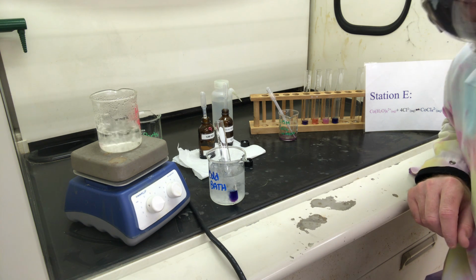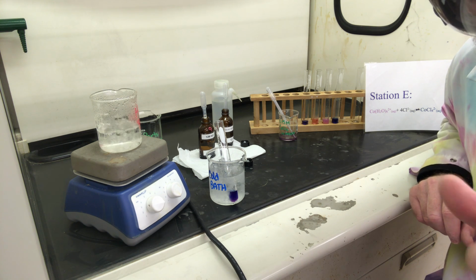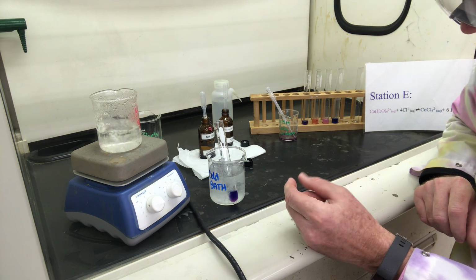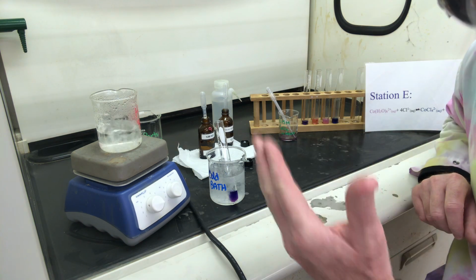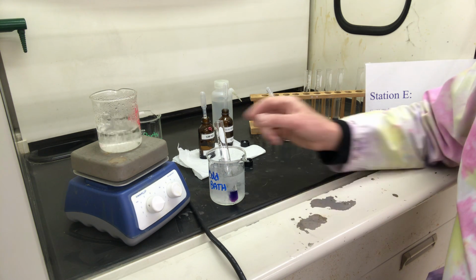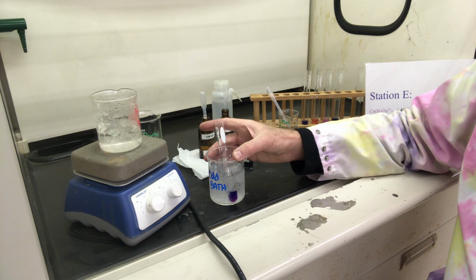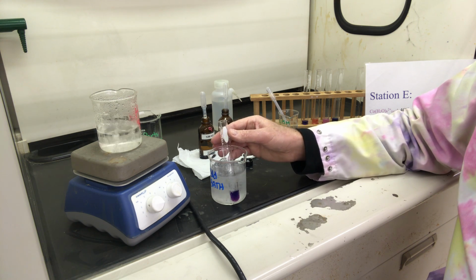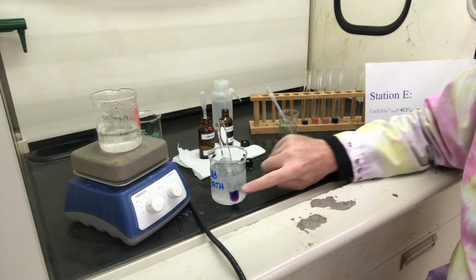What we may want to do during this part is fast forward your viewing a bit, so we can look at the color when it's ice cold and then fast forward to when it was really hot, or vice versa. And I can see a bit of a color change here. We'll see if it comes through on the video or not.